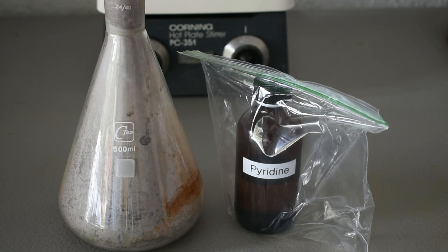I'm going to be doing this on a 25 gram scale according to the pyridine, but I am going to actually use an excess of pyridine because the compound form has to be under pyridine or else it will oxidize in air. I just want it to take most of it and then we'll still have some on top to prevent the oxidation because iron 2 does not like to exist in air.